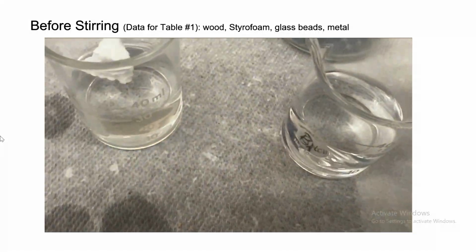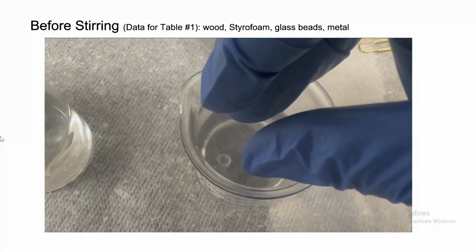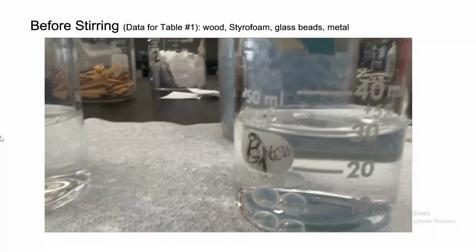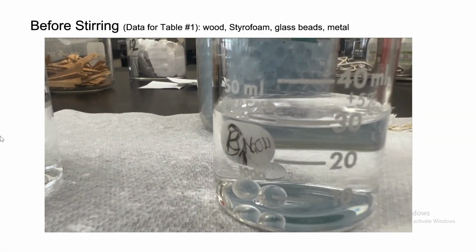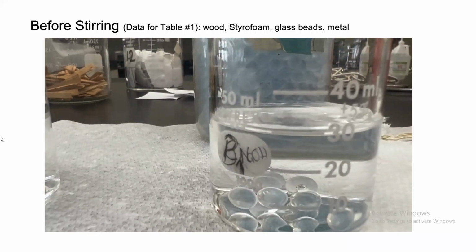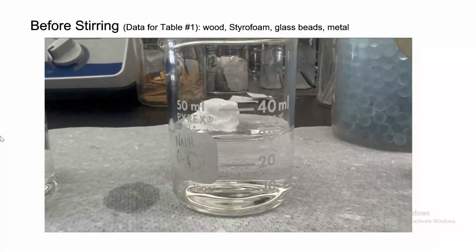Now let's take the glass beads. Drop them in water as we're doing here. Okay, so the glass beads actually sink to the bottom, as you can see in the video. So you're gonna write sinks, and since they sink, what's the conclusion? The conclusion is that glass beads are more dense than water. As we keep adding glass beads, they keep going to the bottom.